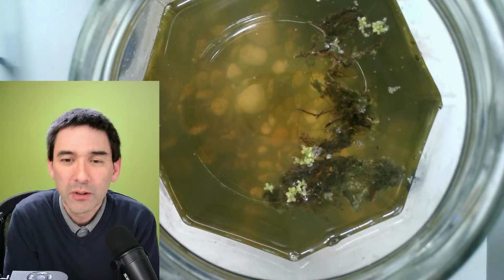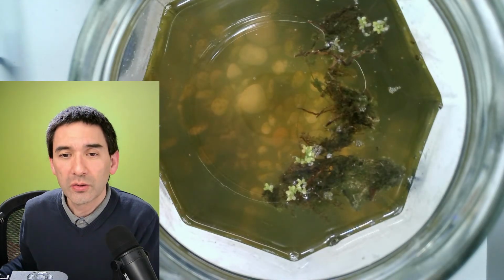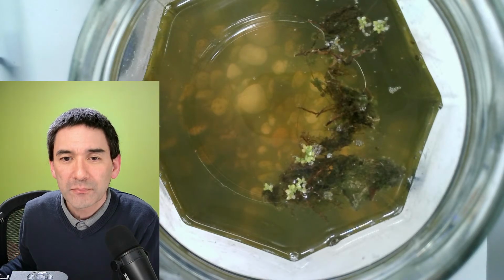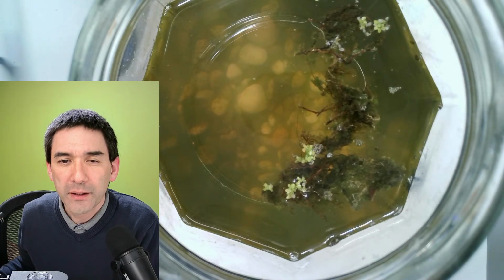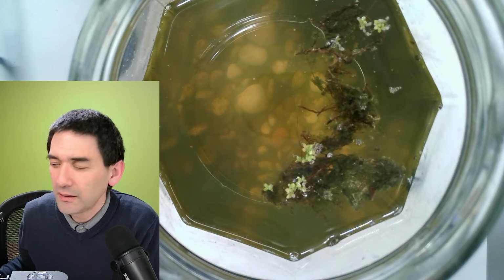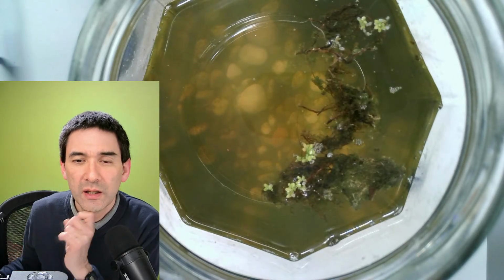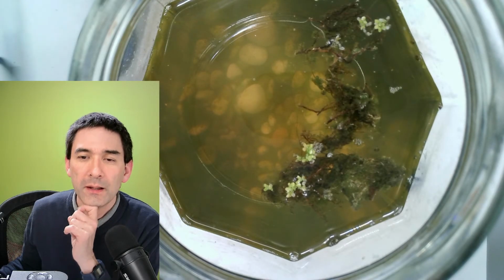Yeah. So what I'm going to do now is, there were so many comments and questions, so I'm going to quickly go through them to see if there's anything relevant for me. Okay. The question is: I would still like to see your microscope. Teeny Coco is saying, I wonder which microscope you mean, if you meant the Olympus one or the other one. I'm going to show you the one that I've been using. I'm a software engineer. Is there a software you wish existed in the realm of microscopy?